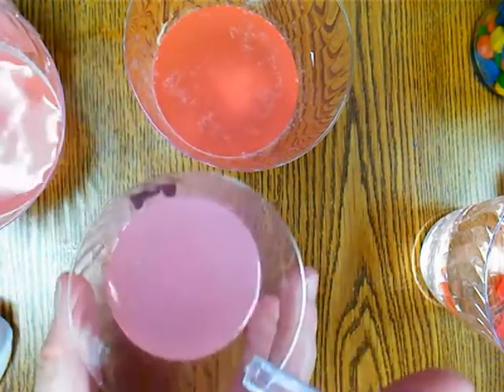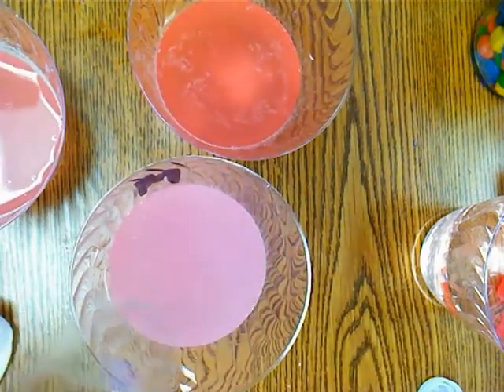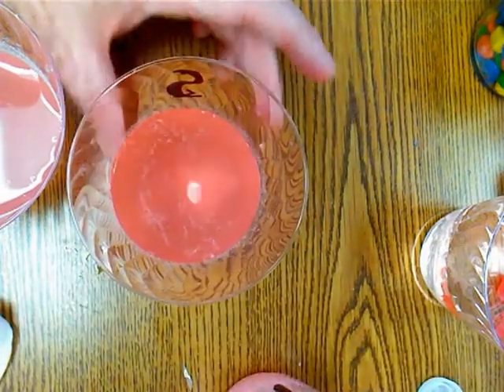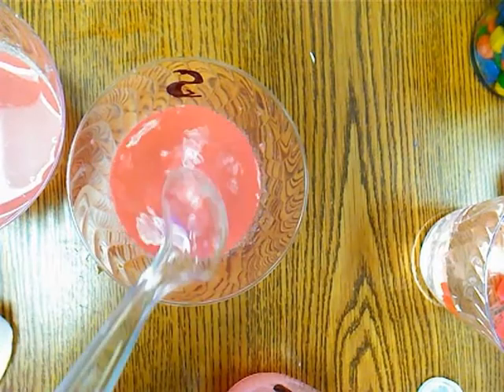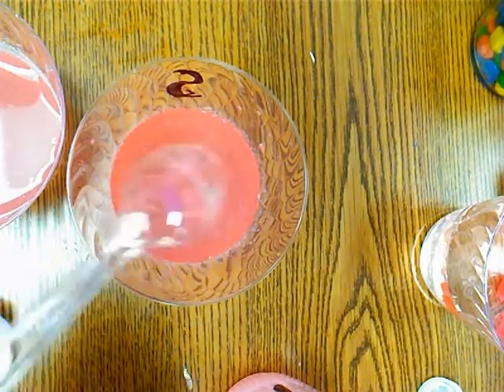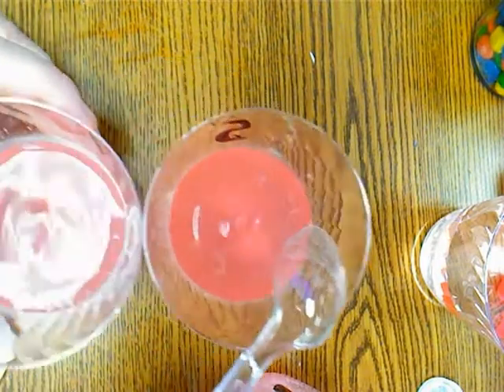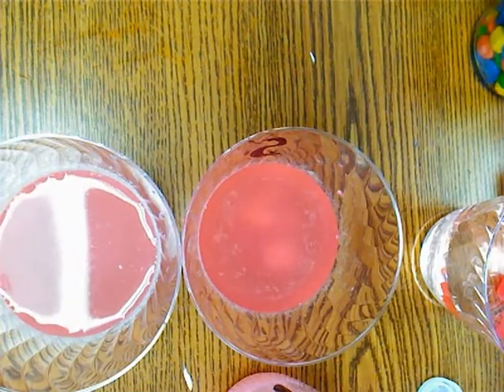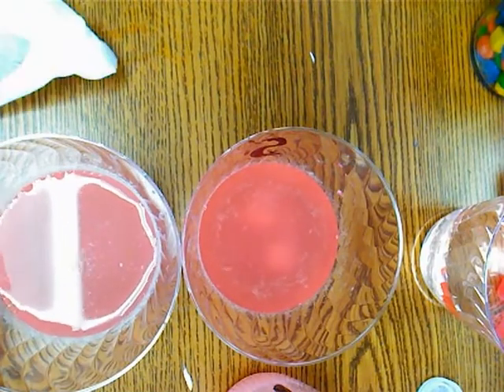This is the M&M. There is no film. It's a lot lighter pink. Okay, and then here's the Skittle, and even though it hasn't been sitting as long as the evidence, you can sort of see that same film forming. So I think our match is going to be the Skittle. So look and see who that was, and let me know if you have any questions.